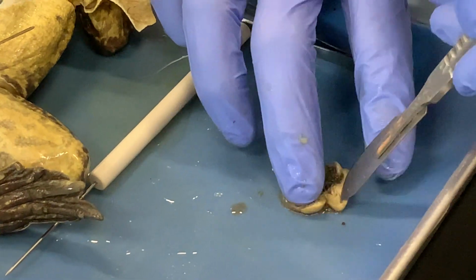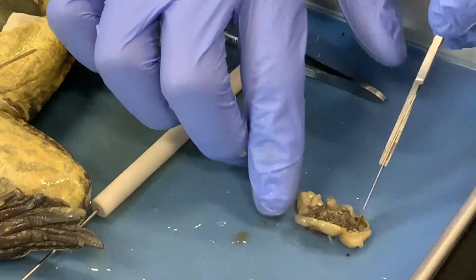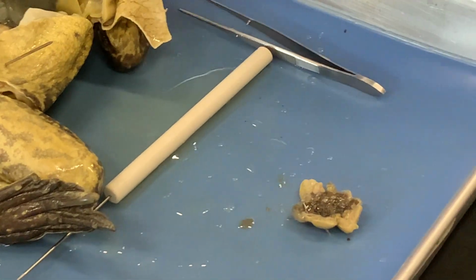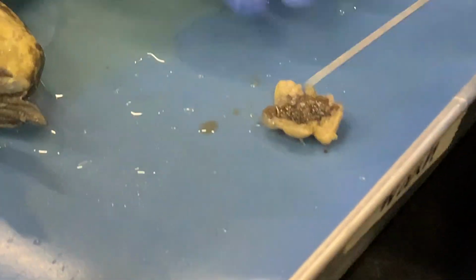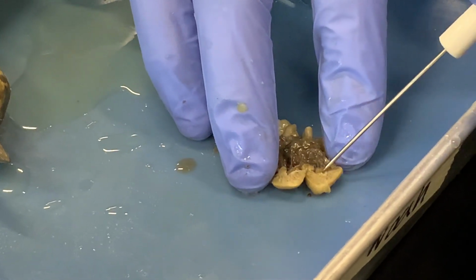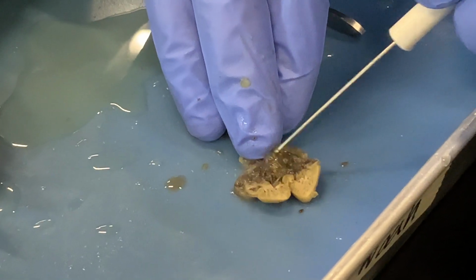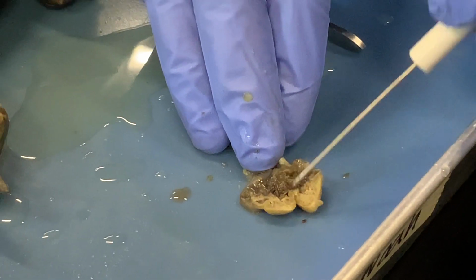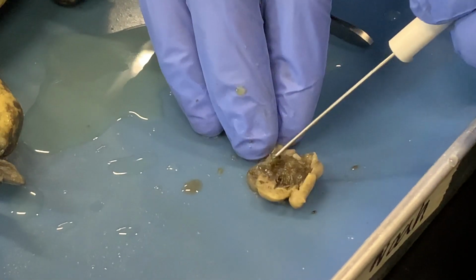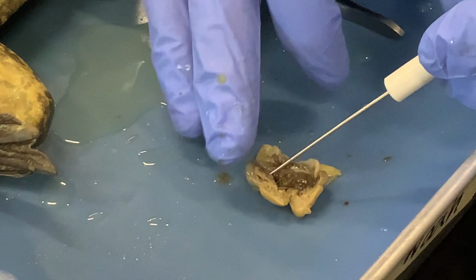So frogs tend to hold on to some blood inside of the heart, which is what this dark discoloration is here. But there is a single very muscular ventricle, which is this light colored portion at the bottom, and a much thinner muscle wall on two chambers, which are filled with coagulated blood, unfortunately.